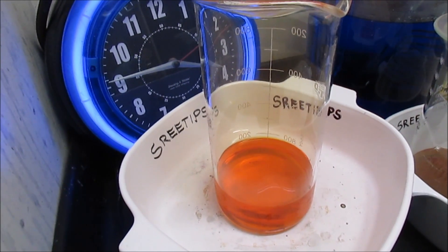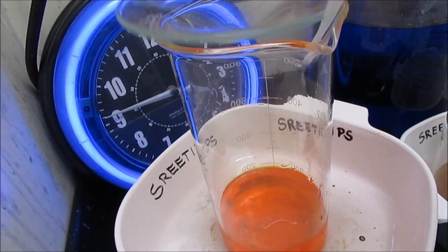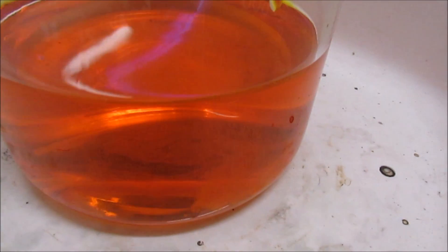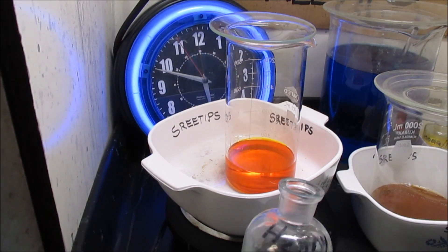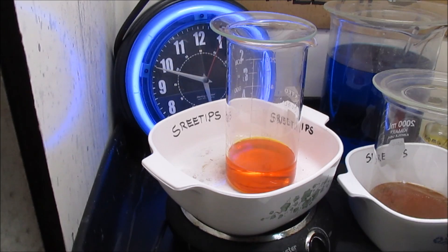The gold has been dissolving now for just over three hours. I've got just a little bit left. I'm going to add a little bit more nitric acid — about 1ml — to get the rest to go into solution. Finally got everything into solution; it's been on about five hours. I'll go ahead and add a little bit of sulfuric acid to take out any lead that might have made it in there. Then I'll turn the heat off and take it off to let it cool.